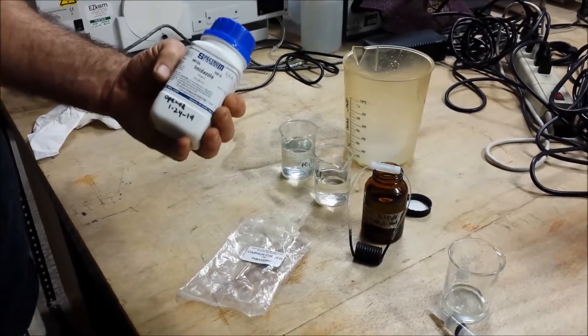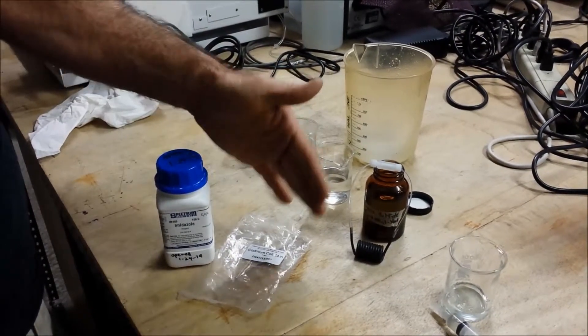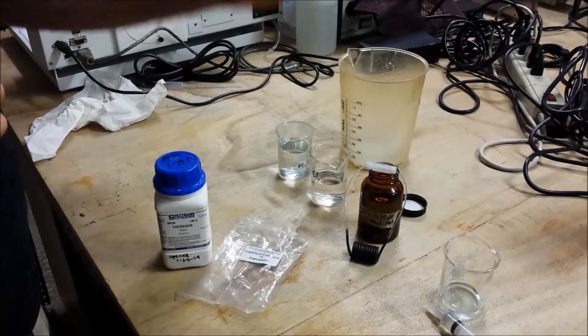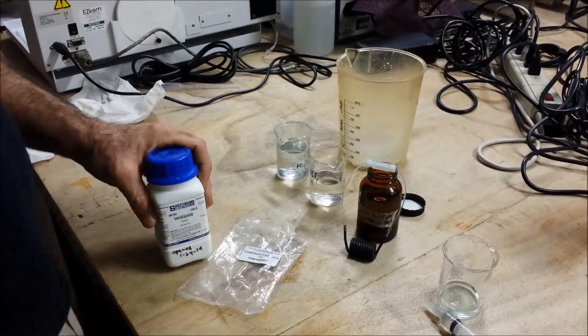The same with leaving buffer in there overnight. That's why we recommend that you flush this out with DI water at the end of the night and store it in DI water, not the buffer.